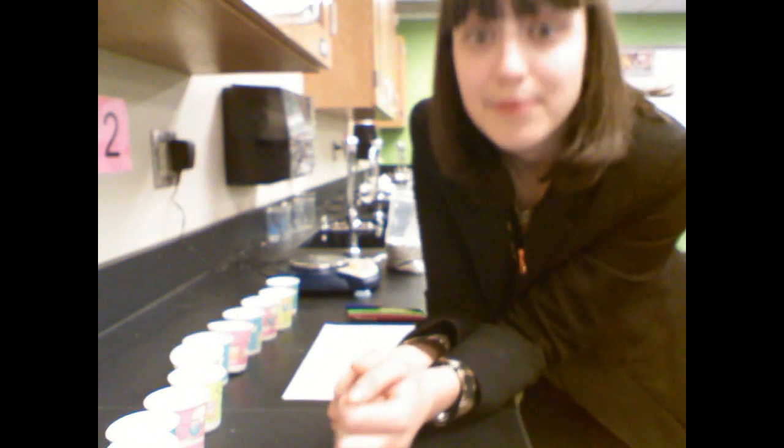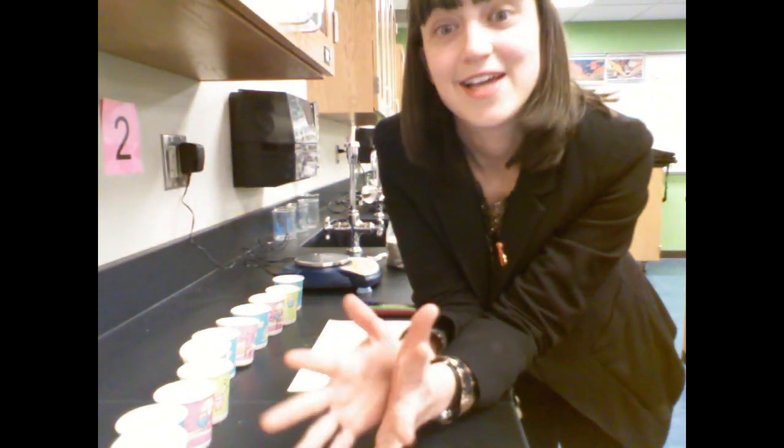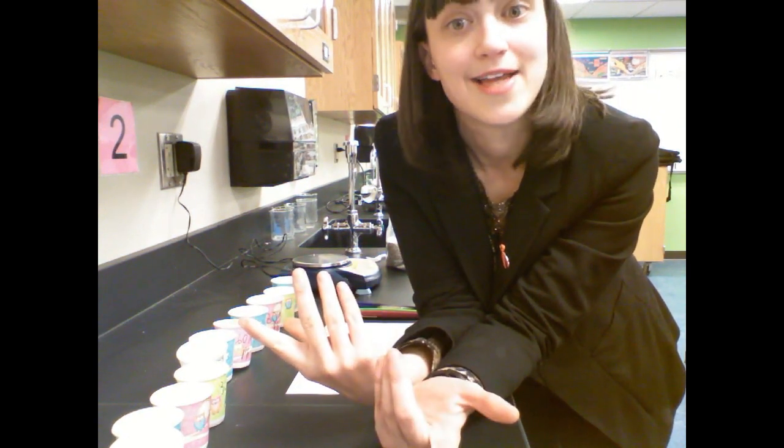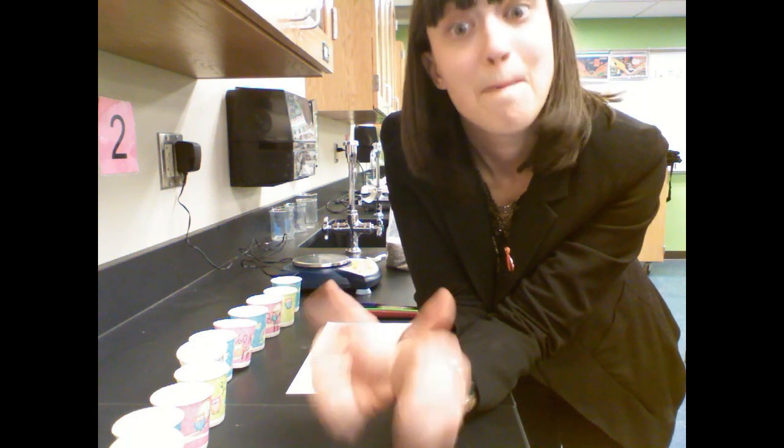But something that has come up time and time again is, how do I get the exact amount correct in the lead and tin? So we are going to math.